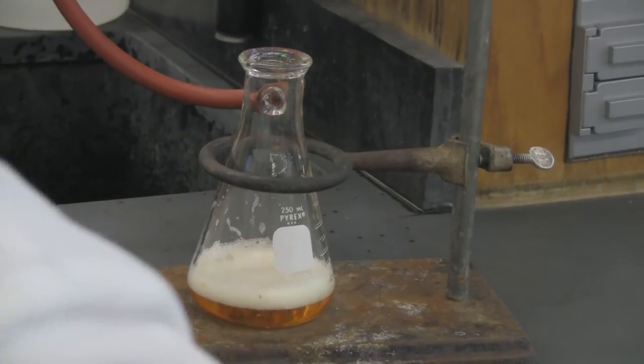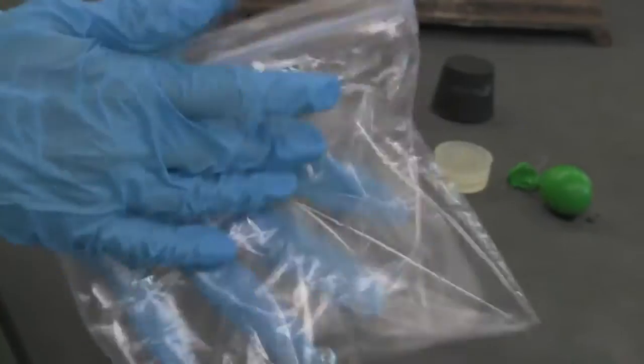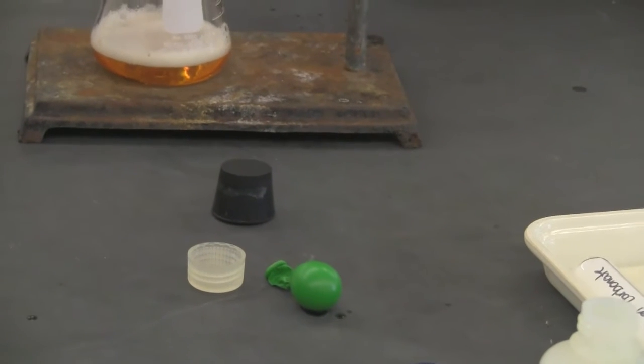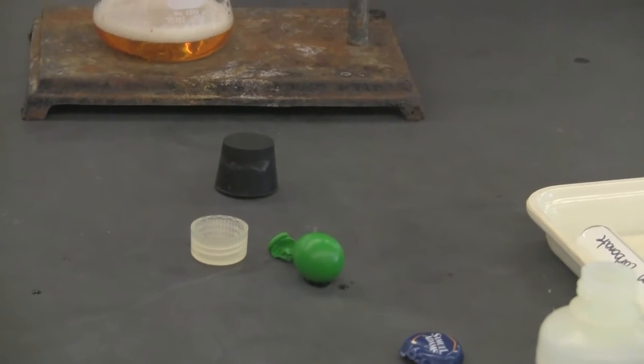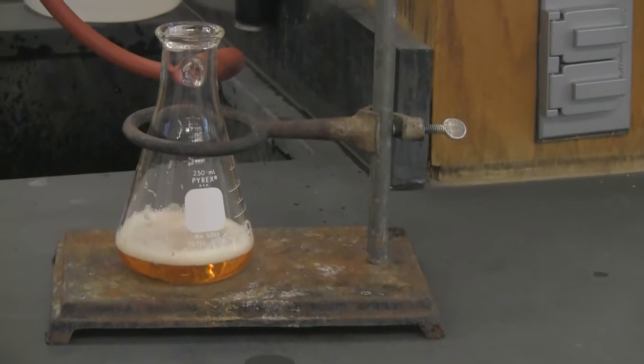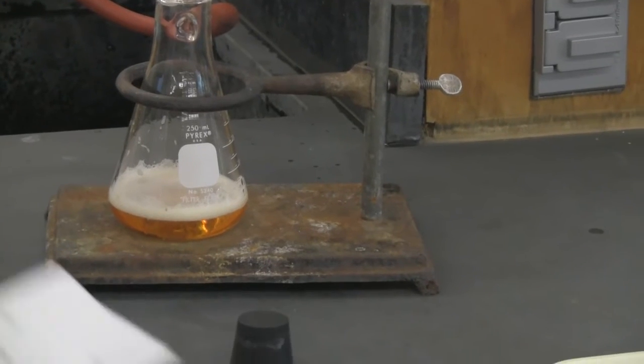Okay. Oh, take a look at the dry ice. It's already, it will blow, it will give us an explosion. So I will just relieve the pressure here. So you feel the pressure, that's from the gas, okay. All right, so Henry's law. Now let's move to Charles' law, part D. All right. Now we need to have the setup in the fume hood.